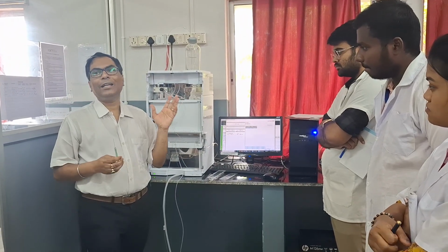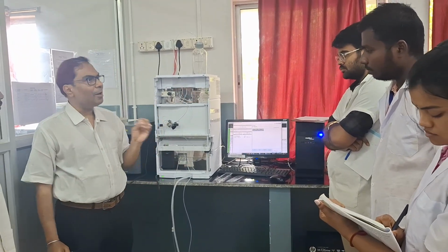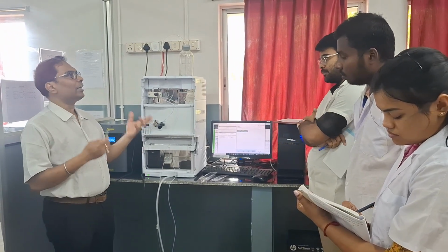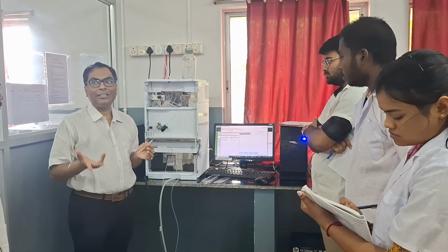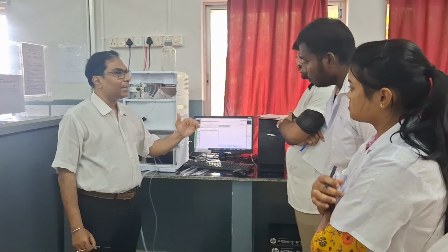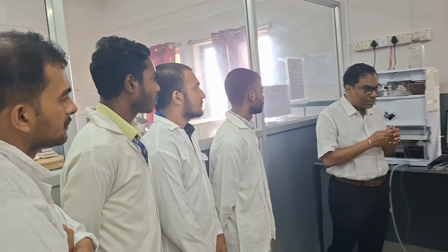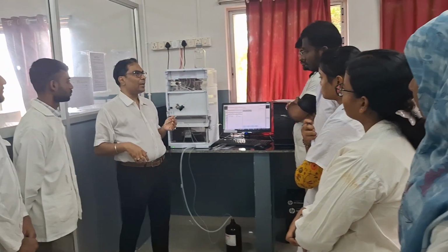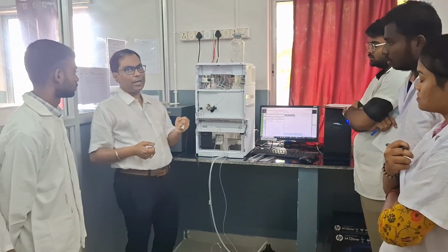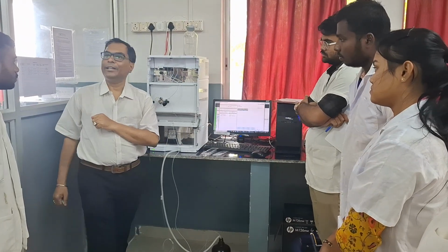we can use qualitative analysis and quantitative analysis. What is quantitative analysis? If we perform any type of assay of any drug or molecule, that is known as quantitative analysis. We can determine the percentage purity. Apart from that, we can also go for separation work, that is qualitative work. If we are using a mixture, maybe a natural product or a synthetic product, and we separate the components from the mixture using this instrument, that is known as qualitative analysis.